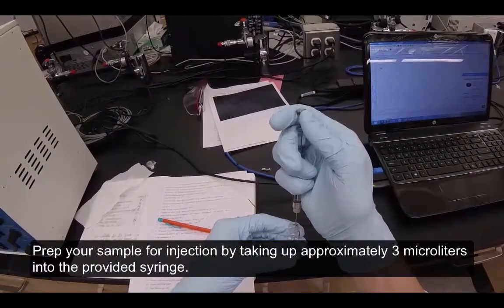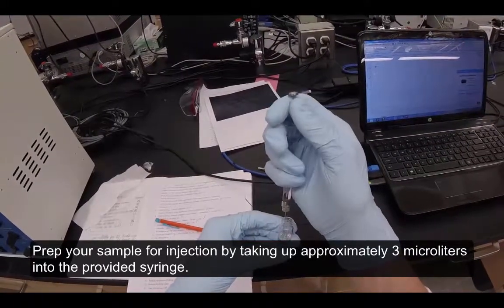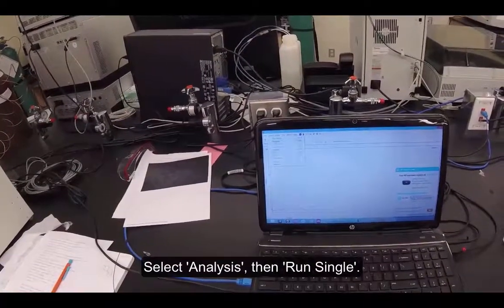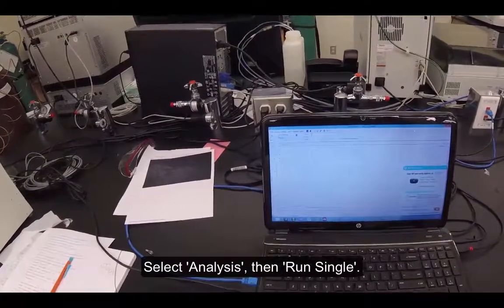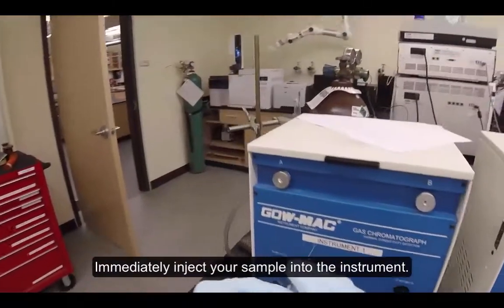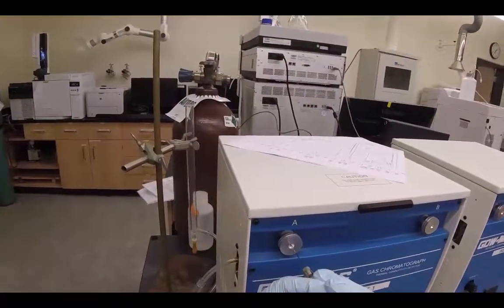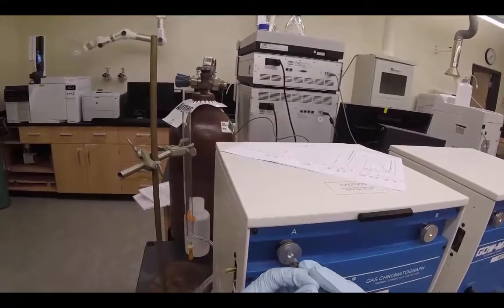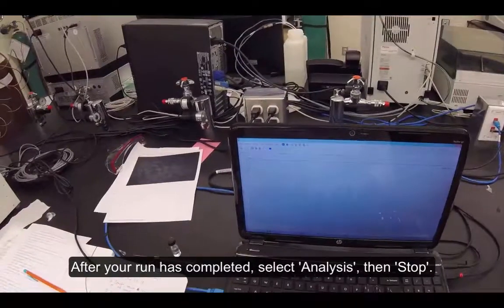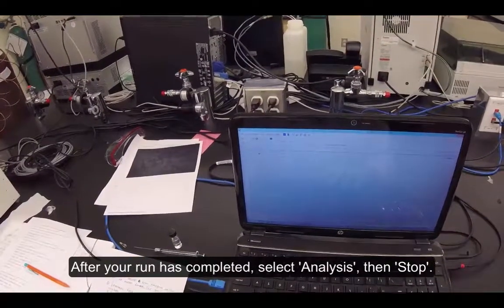Prep your sample for injection by taking up approximately 3 microliters into the provided syringe. Select Analysis, then Run Single. After your run has completed, select Analysis, then Stop.